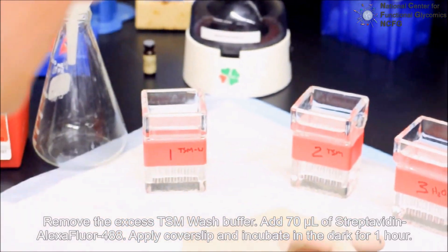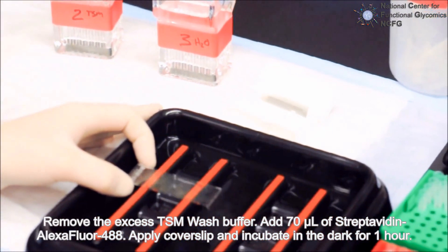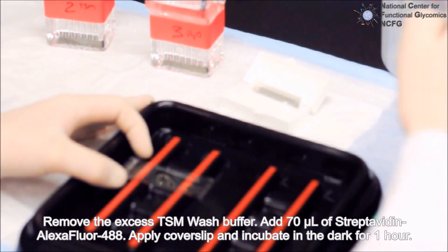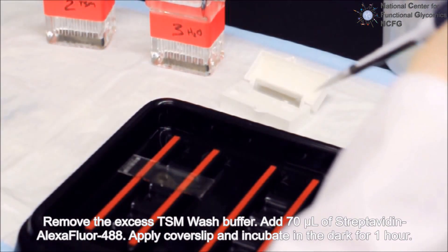Remove the excess TSM wash buffer. Add 70 microliters of fluorescent streptavidin. Apply a cover slip and incubate for one hour in the dark.